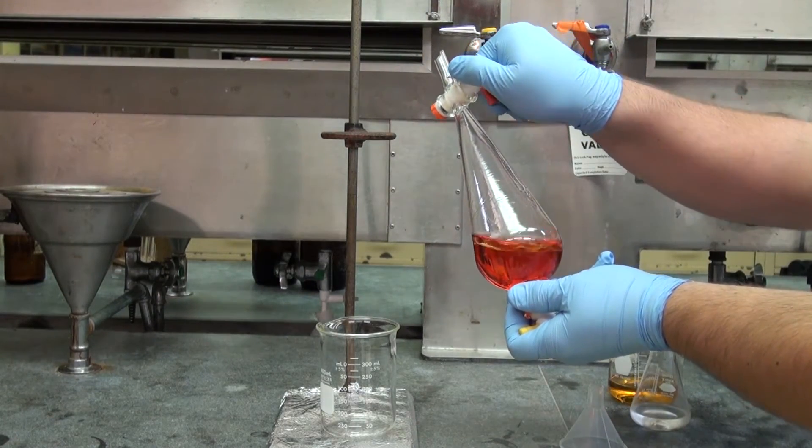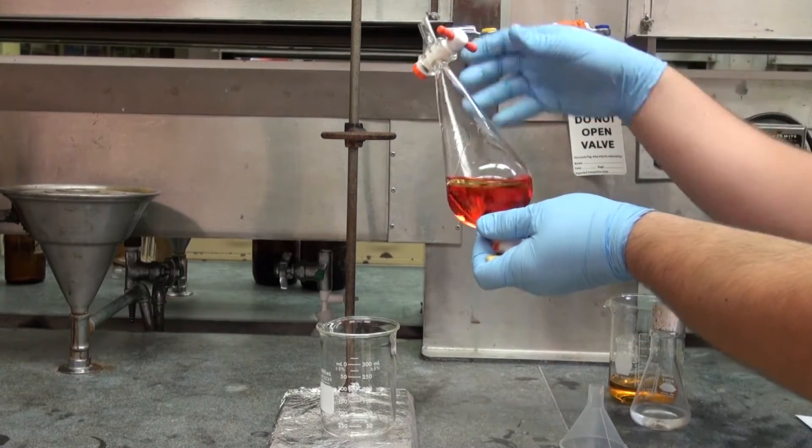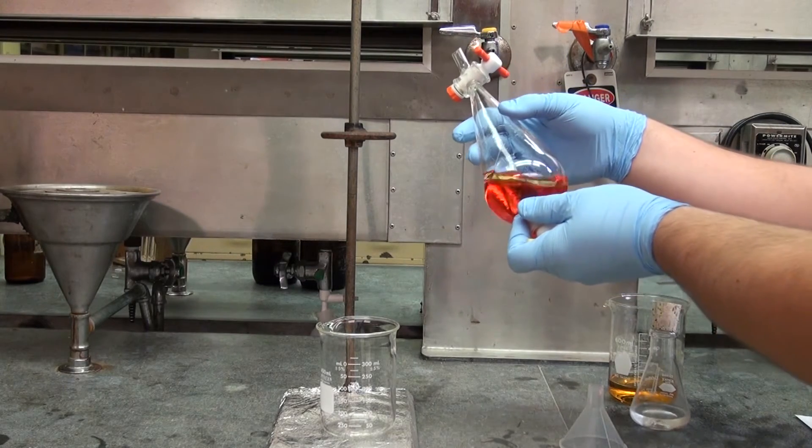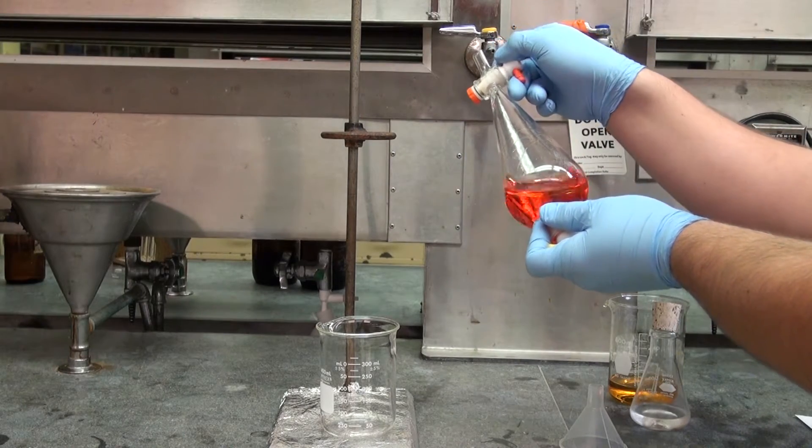Some pressure might have built up and you want to release the pressure by opening the stopcock. Open the stopcock always by pointing out of everybody's way. The direction of the hood is the best choice. Close the stopcock.